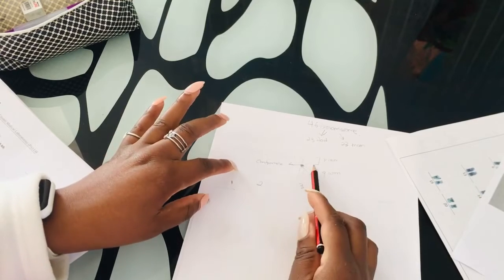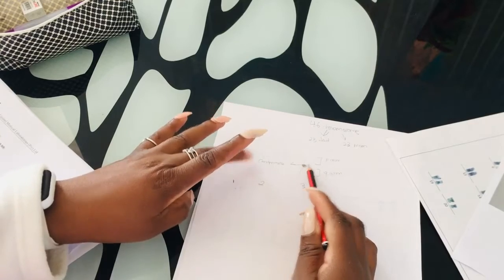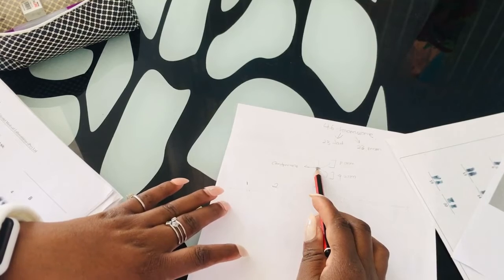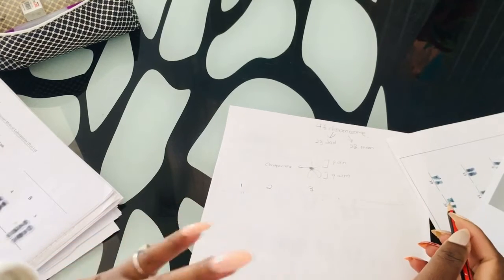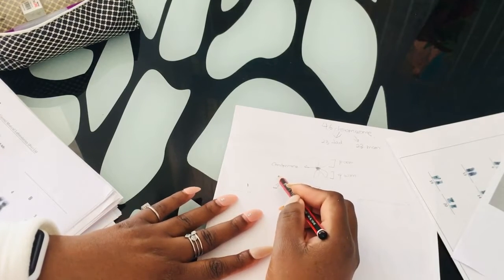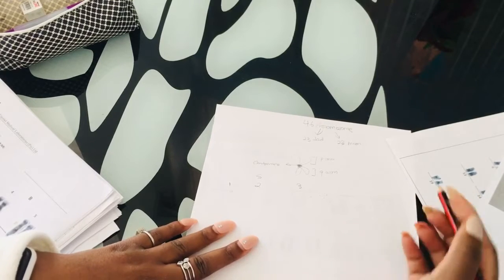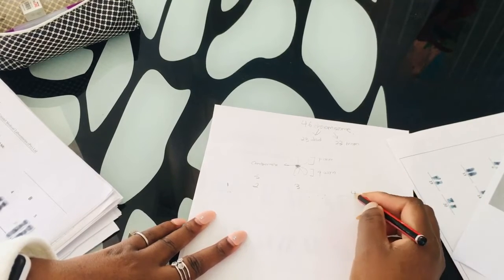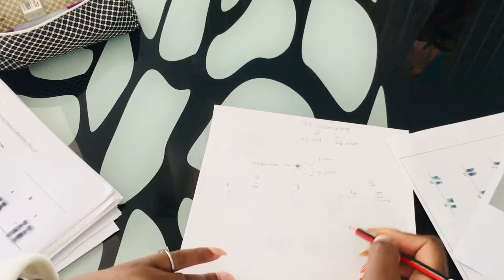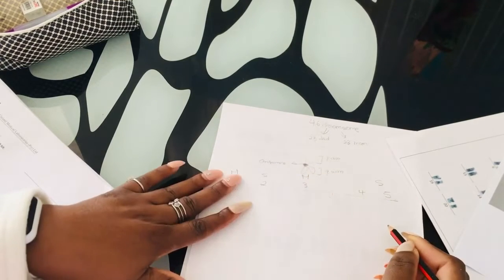Okay, the centromere is located in the middle. You see this little knot that I made here is gonna be in the middle. So chromosome 1 to 3 metacentric, the centromere located in the middle. But you will also read in other textbooks where they say your chromosome 2 is actually a submetacentric. Don't get me wrong, you can find it like this in the textbook. You can also find a textbook that is labeling your chromosome 4 and 5 as submetacentric, and they will label your chromosome 1 and 3 as being metacentric, you see.